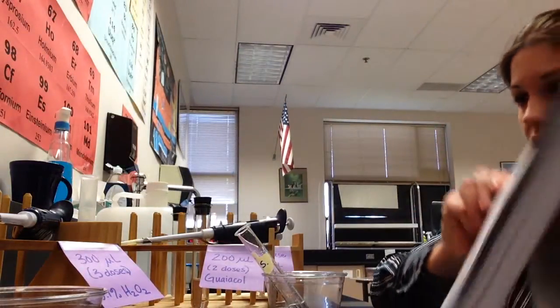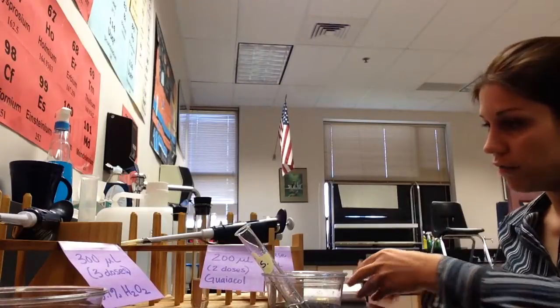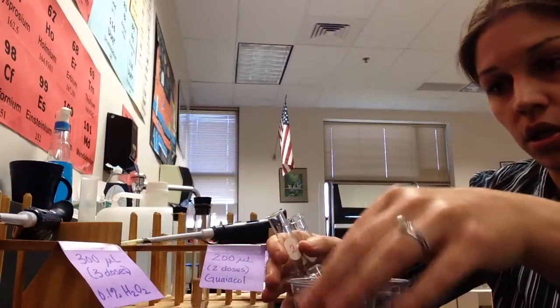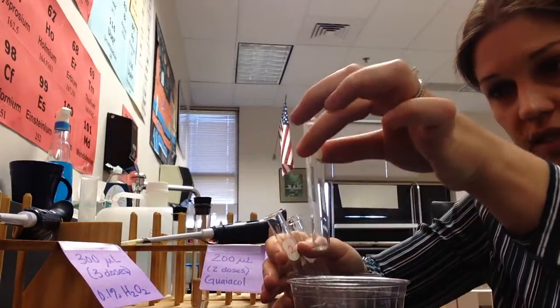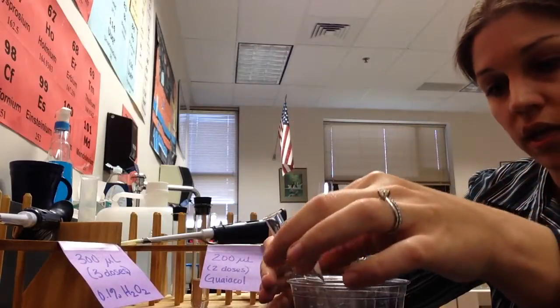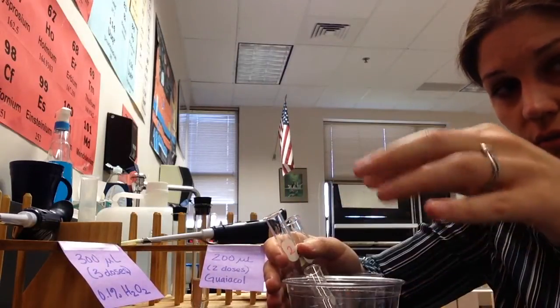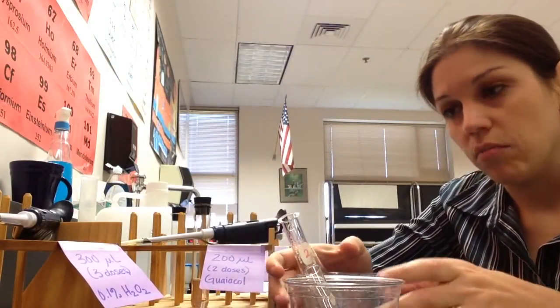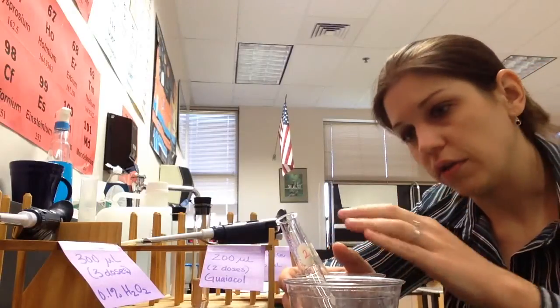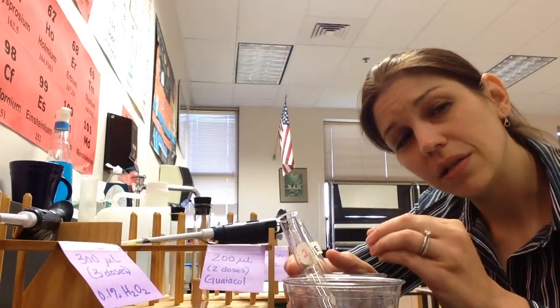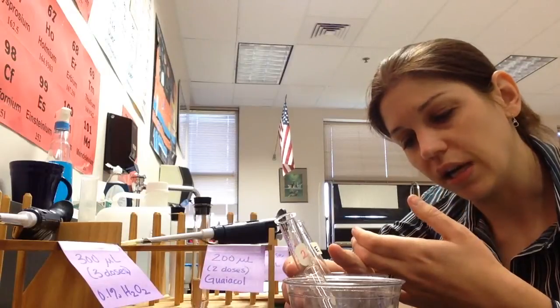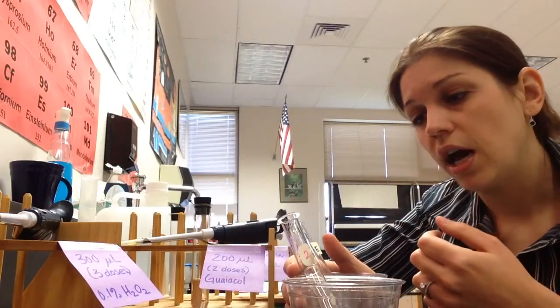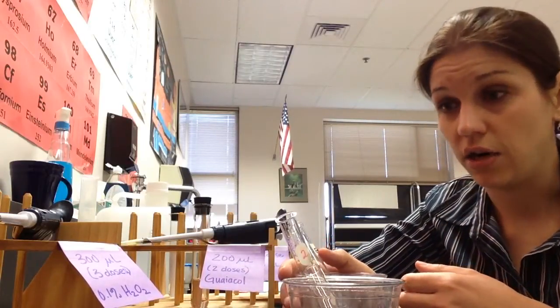So at this point, you have your two test tubes, and then you have also obtained your cuvette. Okay, because this is the one that actually fits in your spectrophotometer. And so this is certainly a two person job. And so what I'm about to do, being that I am one human, is not going to be quite as graceful as what you're going to do. Bearing in mind that, and it tells you this in your lab notebook, the guayacol can be a skin irritant. So you don't really want to get the guayacol on your hands. It's actually very rare that somebody has a reaction to, or a skin reaction to touching guayacol. But just on the off chance, the goal here is not to get it on yourself.